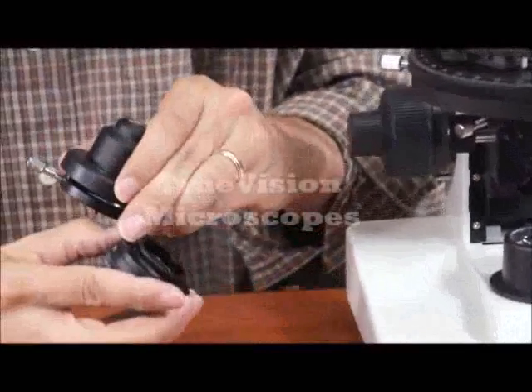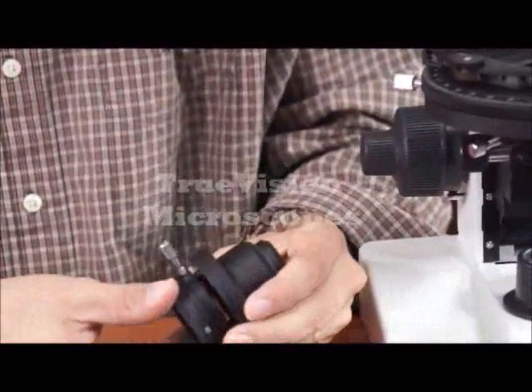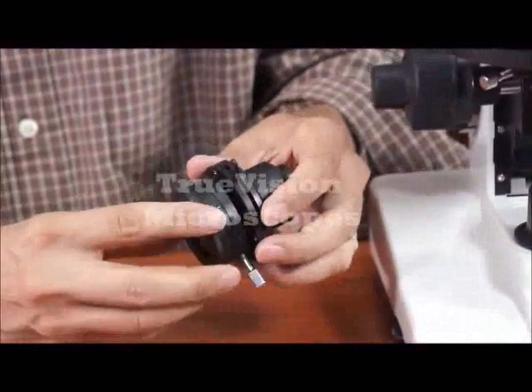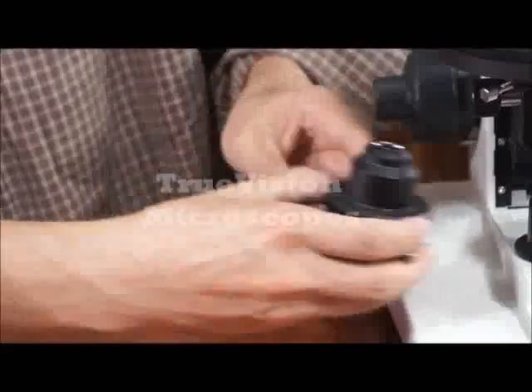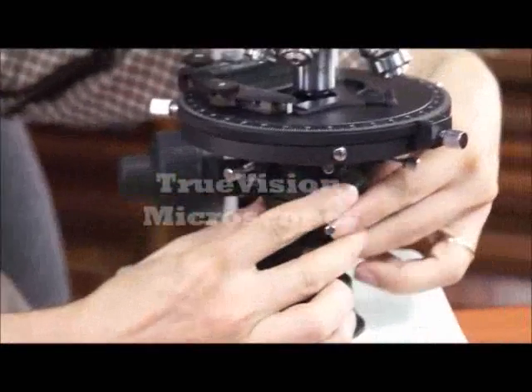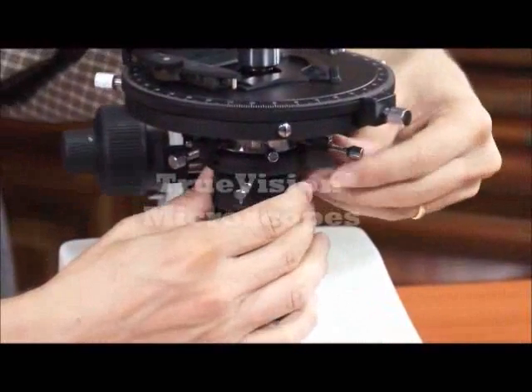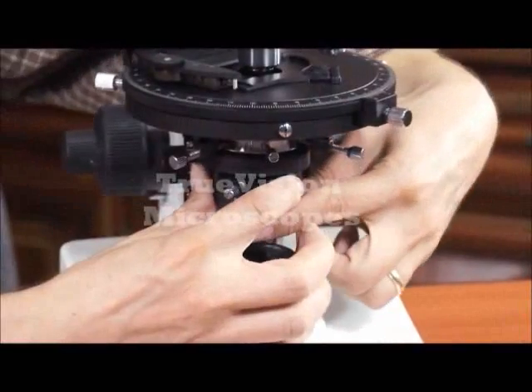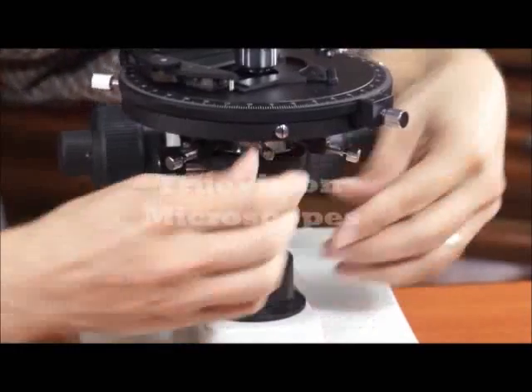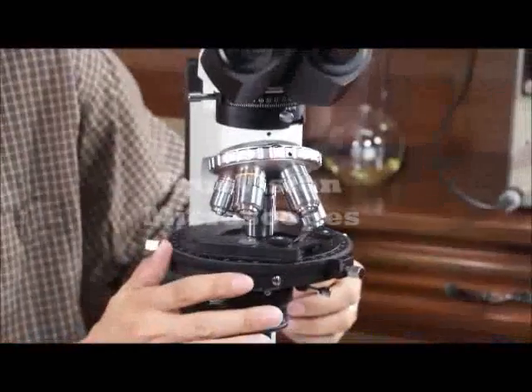This screw fits up with this opening. Now put the condenser back in place.